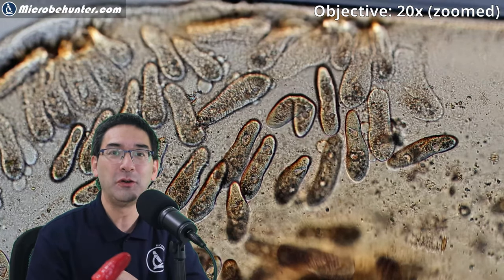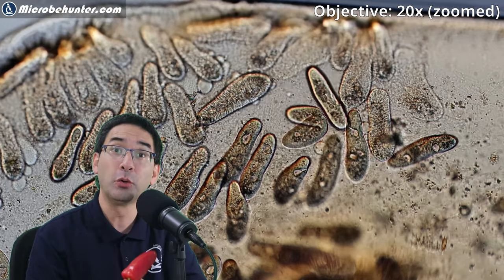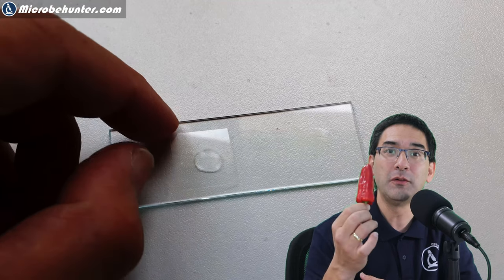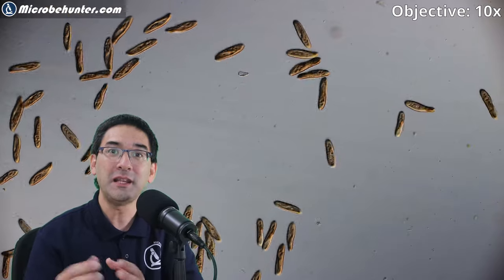I'm going to show this to you, but there's a little bit of science involved here too — I'm also going to try lower concentrations. I've discovered that this might actually anesthetize them, which is very convenient because when they stop moving it's easier to observe them. First, I'll show you their normal movement, and then I'll add some of the chili pepper substance.